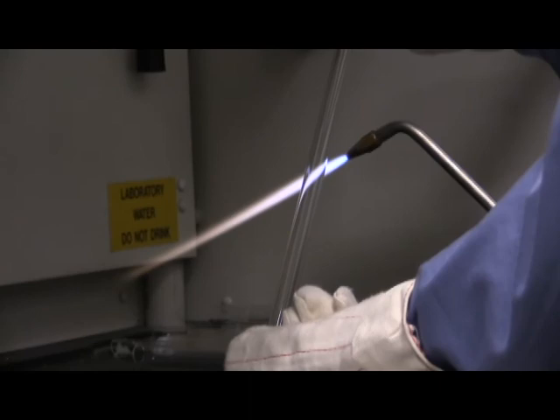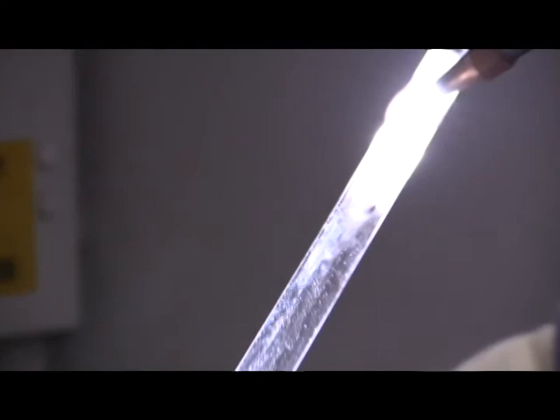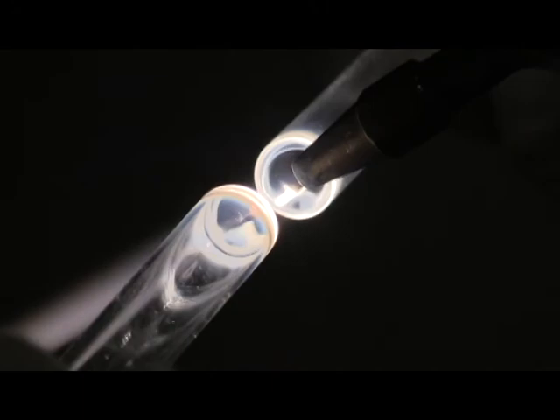The glass is made from quartz and is very temperature resistant. We use a 2,000 degree hydrogen torch to melt it. The melting glass becomes extremely bright so we wear protective eyewear.